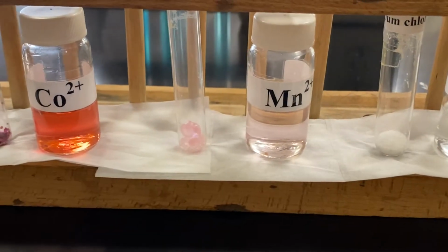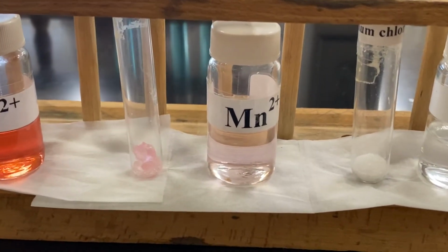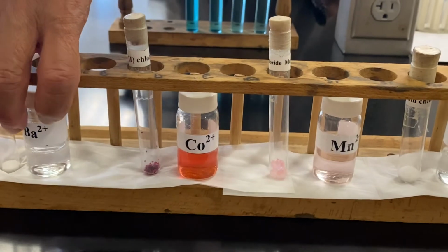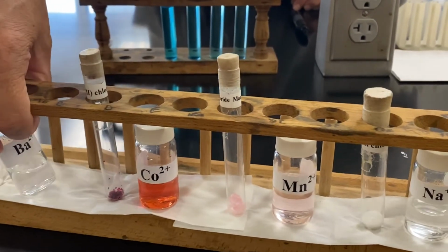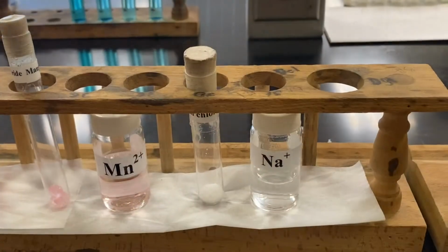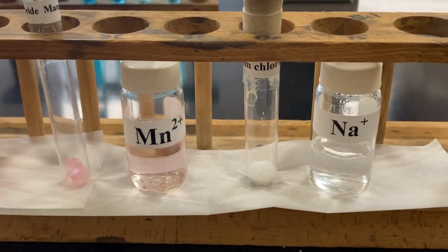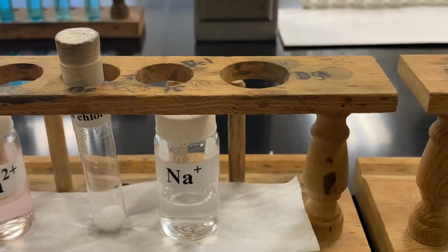Chloride solution, without any comparison, you will say, that is colorless. However, we will have the true colorless, which we have introduced to all of you just a few minutes ago, and then barium. Side by side with our manganese 2 chloride, then you will see, that's actually very, very faint pink, okay?